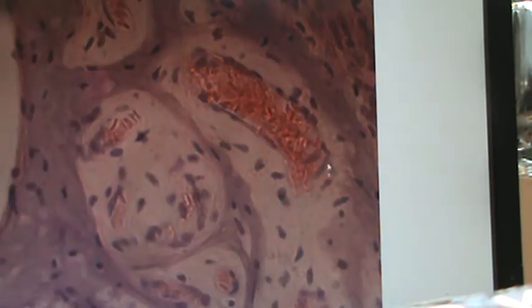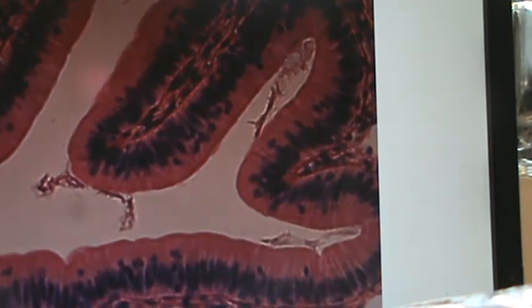Oh, and here's another. You can still see some more cartilage over here, but another thing to watch is going along this edge, and you can see the simple squamous cells right along the edge. So major tissue type here would be epithelial, and the specific type would be simple squamous. And these other things out here would be cartilage. Okay, and here's another. You can see some blood. Again, you can see some edges here where you see the epithelial tissue, and there's some areolar connective tissue inside here. Okay.